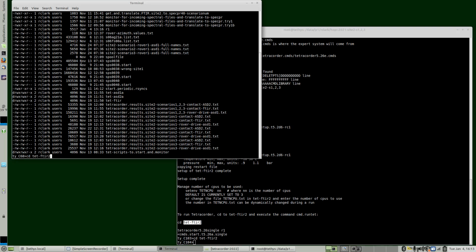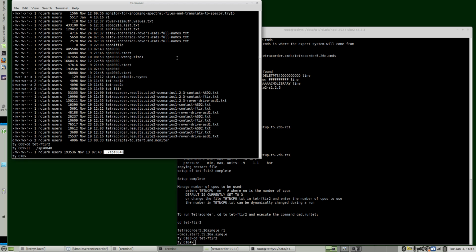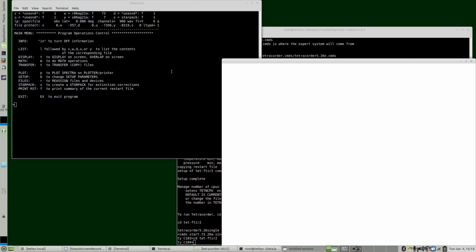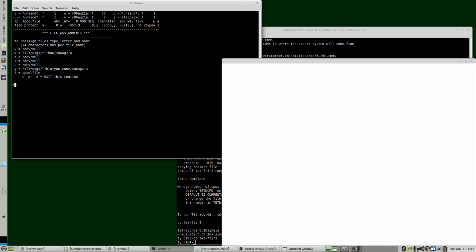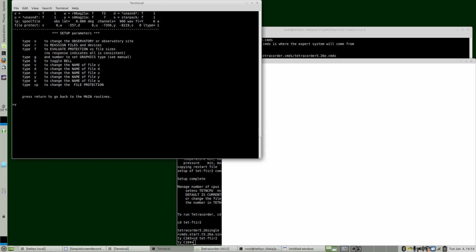Before we actually do the Tetracorder run, the restart file doesn't have the test spec.pr file that we need. The test spec.pr file is here, which is from this subdirectory is up one directory. So we need to add this to the restart file. We can do this by starting spec.pr. You see that there's nothing assigned to the letter V, so let's go and reassign letter V. Okay, that looks good. Change the name of V. Done. Set the protection.